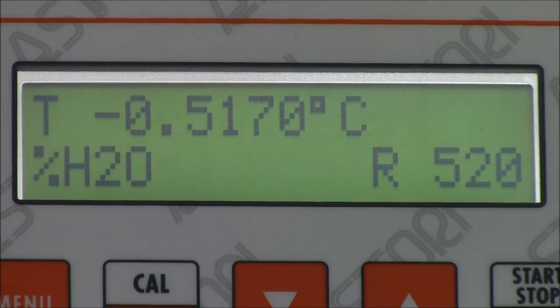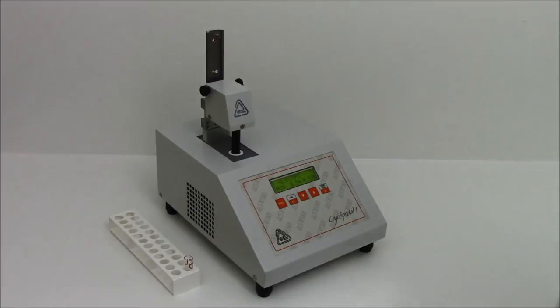After 2 minutes, an acoustic alarm will inform you that the analysis has completed and the results will be shown automatically on the display.